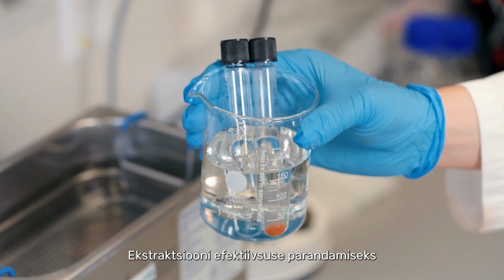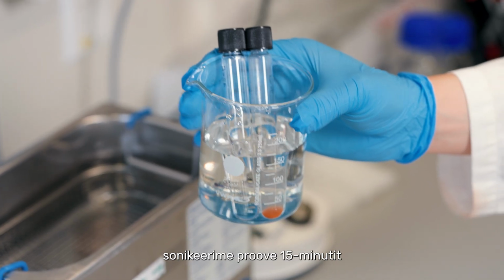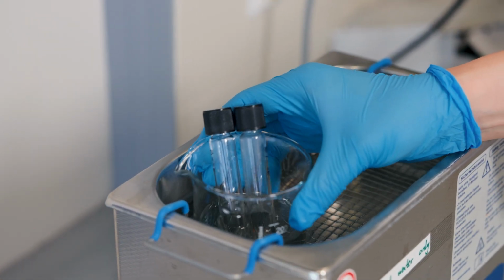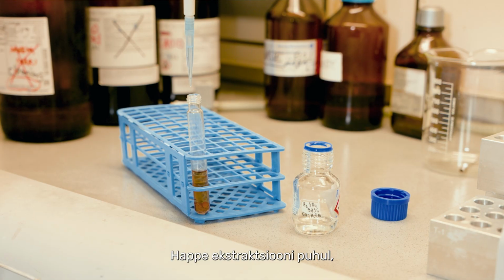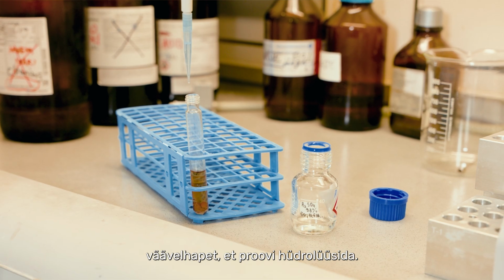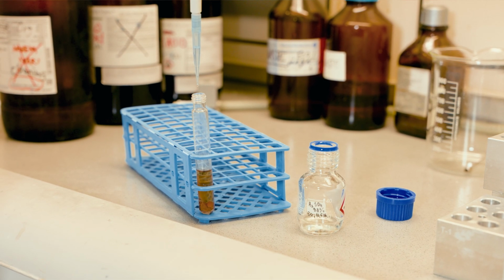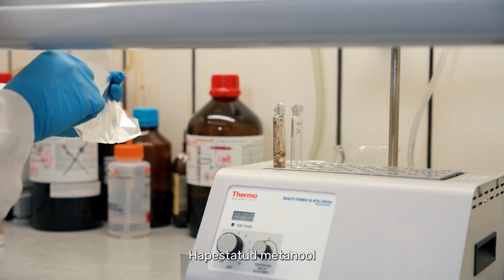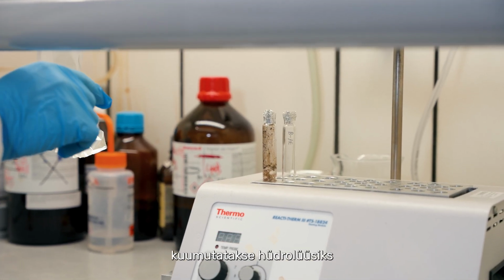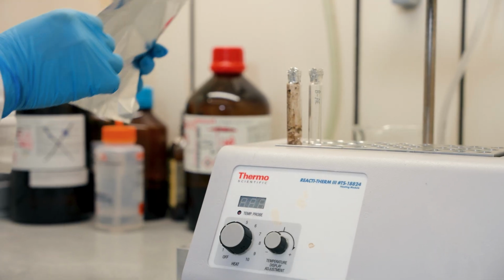To enhance the extraction efficiency, we will use the sonication for 15 minutes. For acid extraction, after sonication, we will add sulfuric acid for hydrolyze. Acidified methanol together with the sample will be heated for hydrolyzing at 70 degrees for 4 hours.